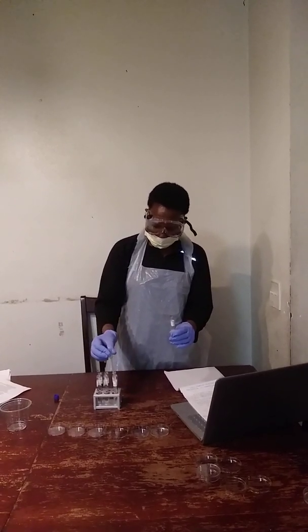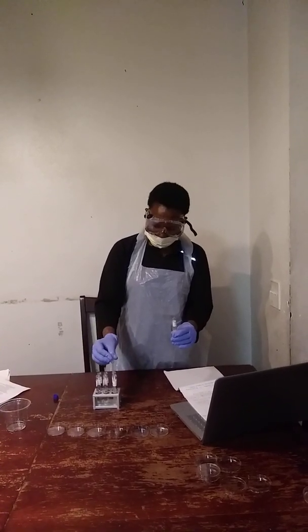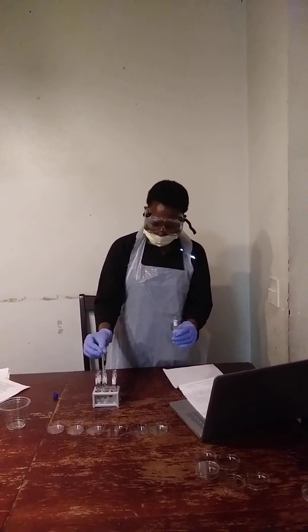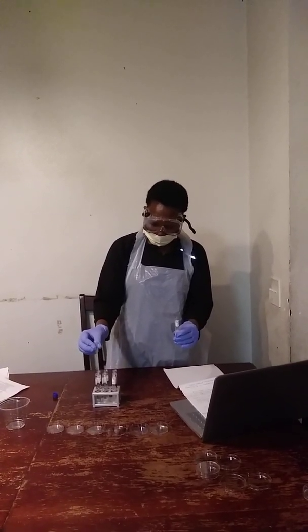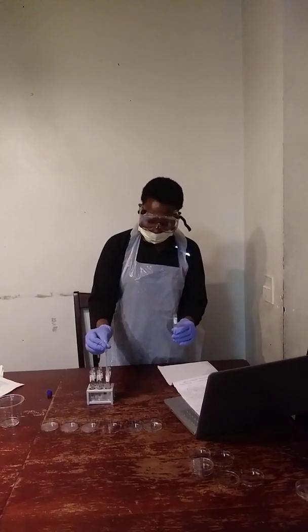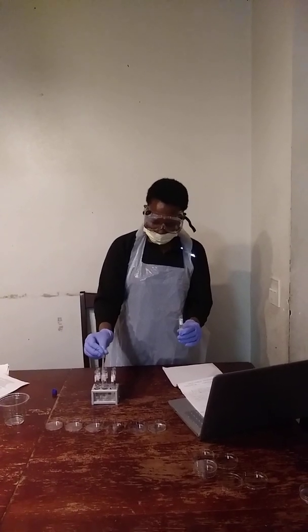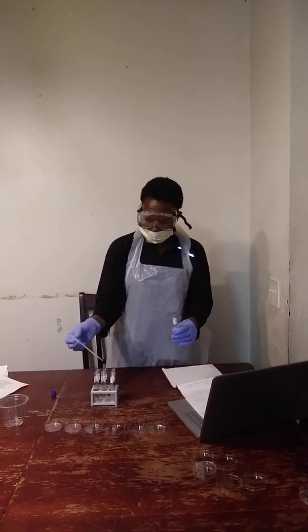and then from test tube 1 I will take 0.5 to test tube 2, and then from test tube 2 I'll take 0.5 to test tube 3, and then from test tube 3 0.5 to test tube 4, and from test tube 4 0.5 to test tube 5, from test tube 5 0.5 to test tube 6.